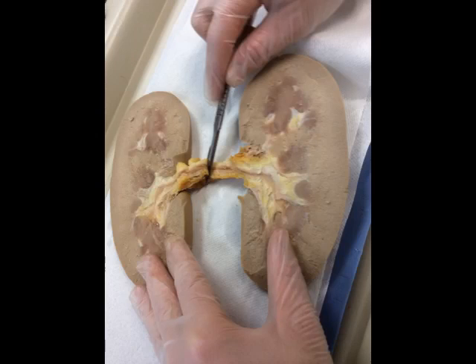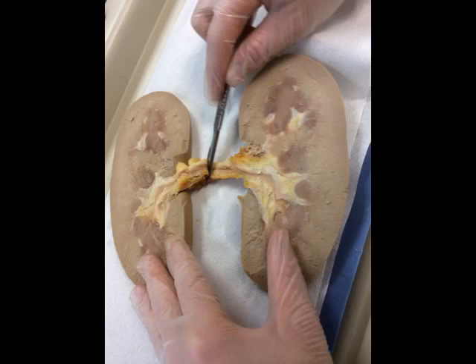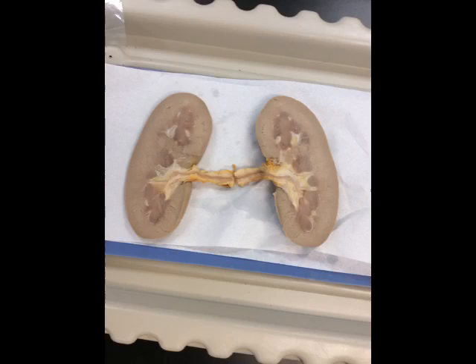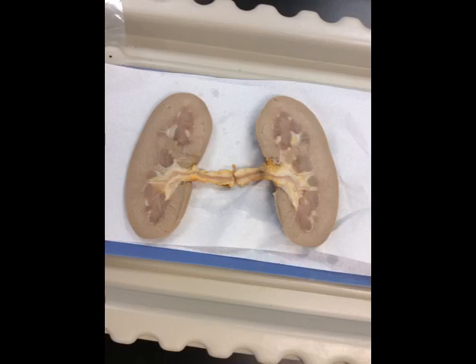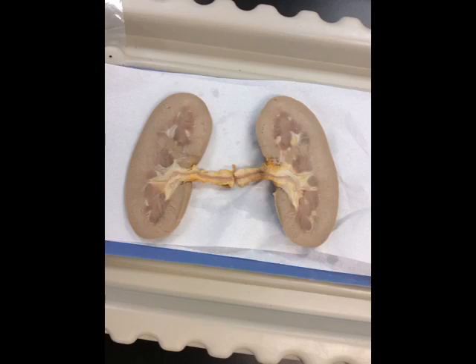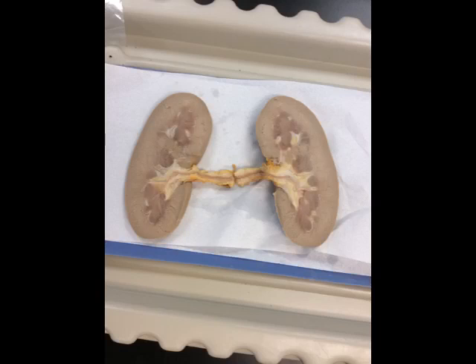When you reach the ureter, carefully cut the ureter into two equal halves. Once you have two halves of the kidney, each half of your table should now have a half of a kidney to begin the observations of internal structures.